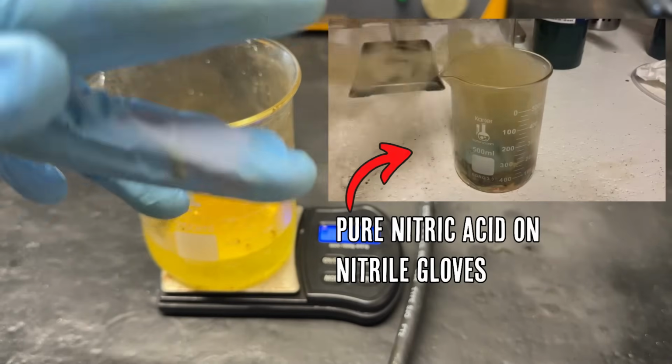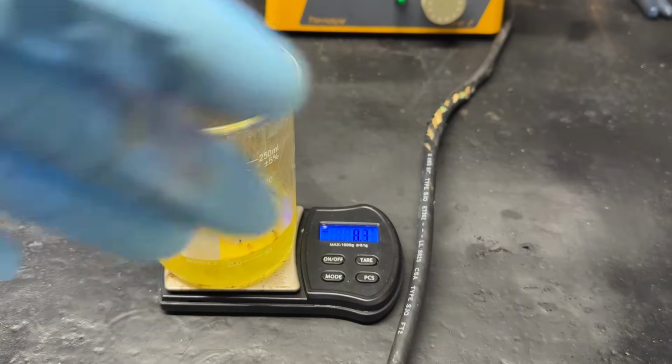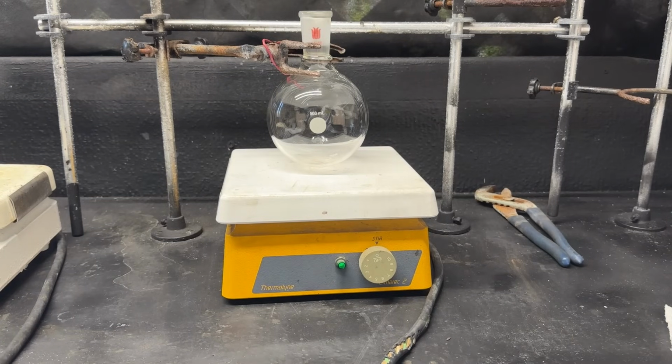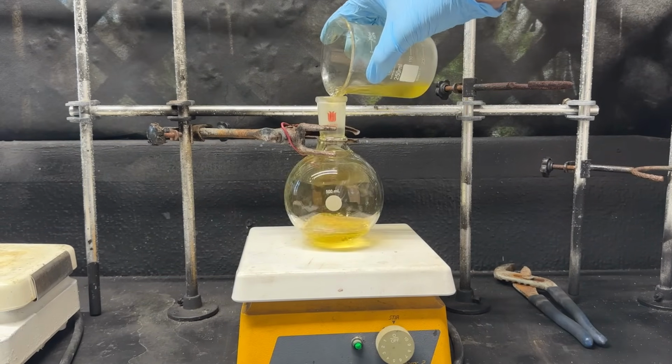See the discoloration on my gloves? That's just from the fumes touching my gloves. Yeah, stuff's pretty nasty and can spontaneously ignite nitrile gloves. Anyway, so now I'm going to go ahead and add this all to this 500 milliliter round bottom flask. And this is where we will be doing our oxidation.